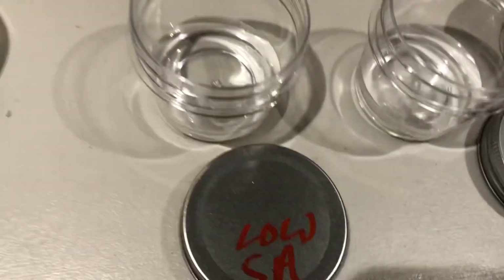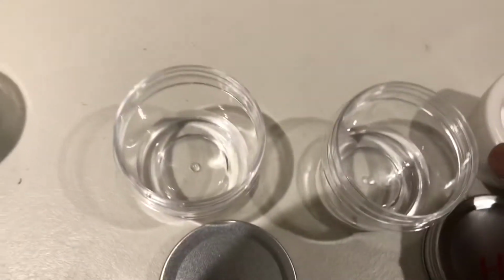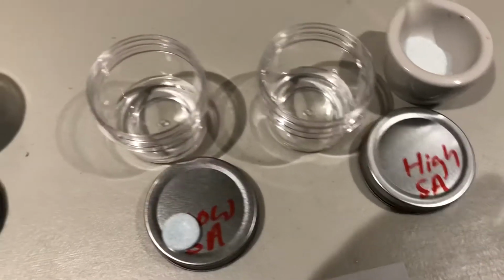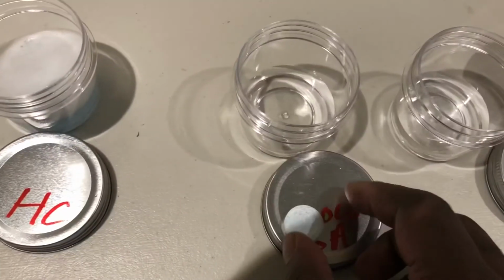So what I'm going to do first, I am going to drop this guy in first, and then I'm going to try and do this one a little quickly right after, okay? But once again, I should have been doing this simultaneously for the purposes of accuracy in the experiment. No problem. Okay, 1, 2, 3, bam, and I'm going to sprinkle that guy in there, bam. Okay, let's see.